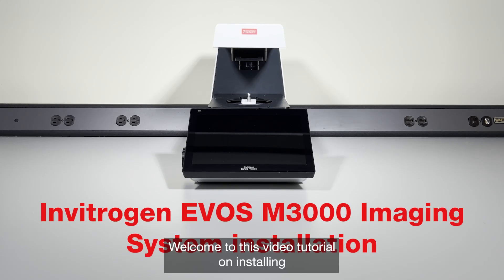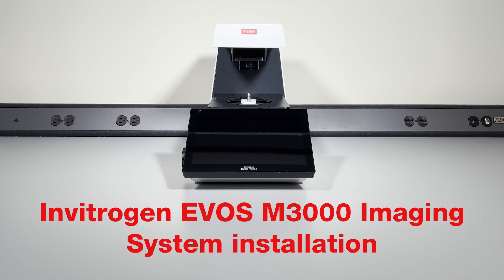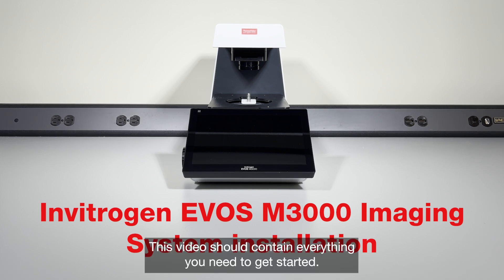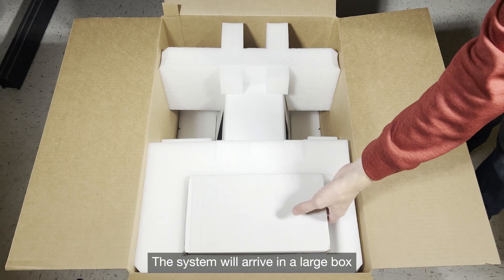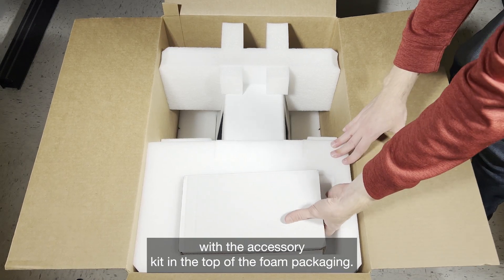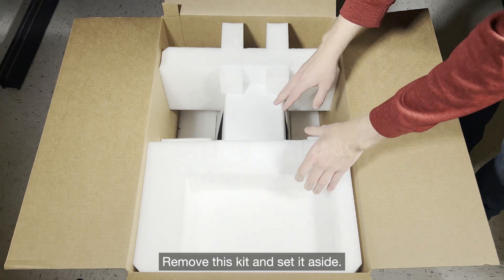Welcome to this video tutorial on installing the EVOS M3000 imaging system. This video should contain everything you need to get started. The system will arrive in a large box with the accessory kit in the top of the foam packaging. Remove this kit and set it aside.